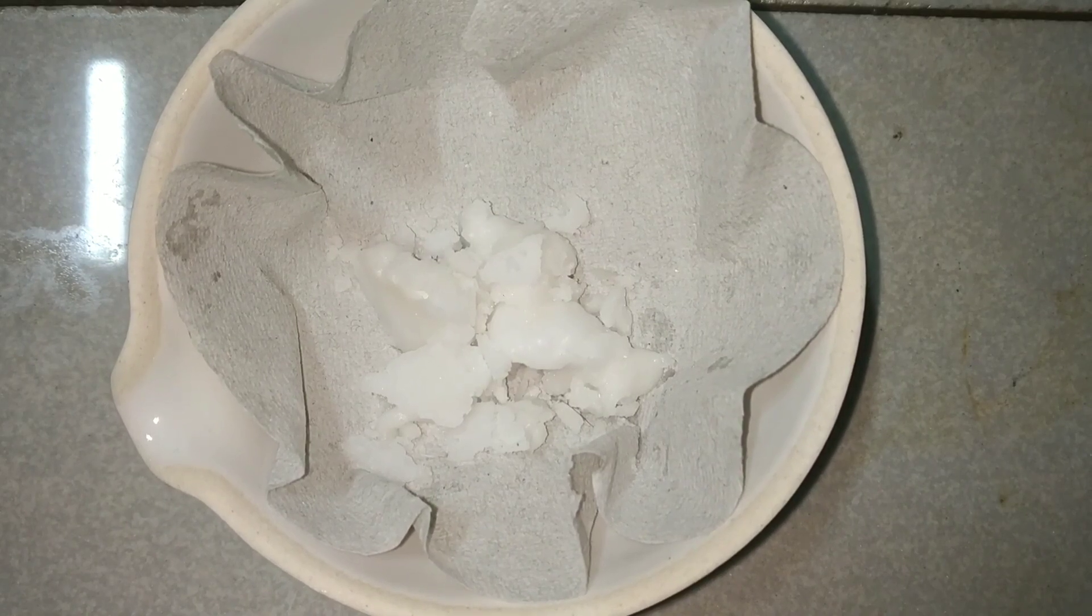The final yield was about 83%. I got about 10 grams of it. Now let us see the chemical properties.